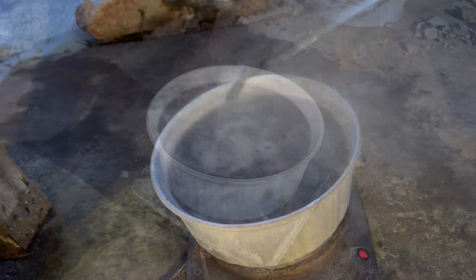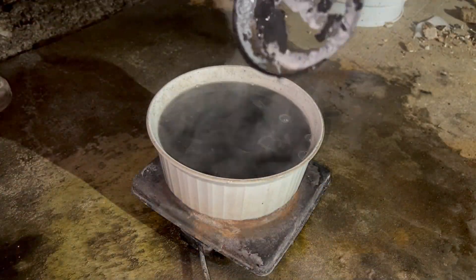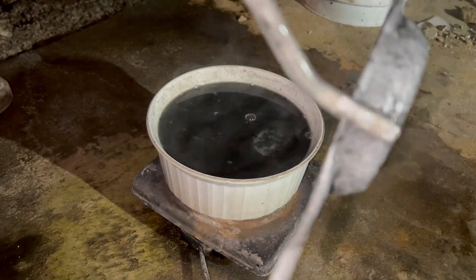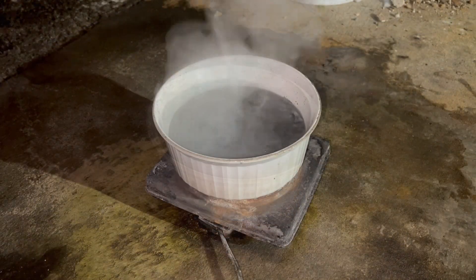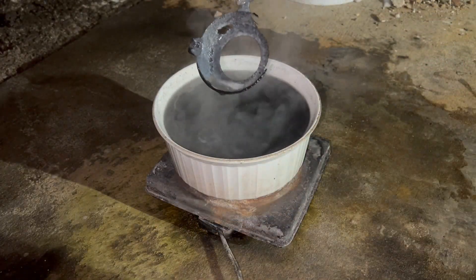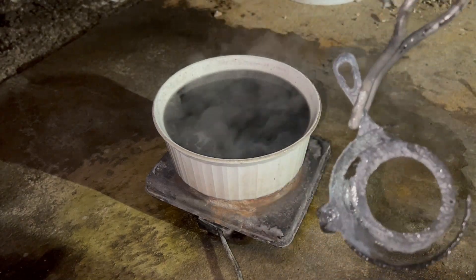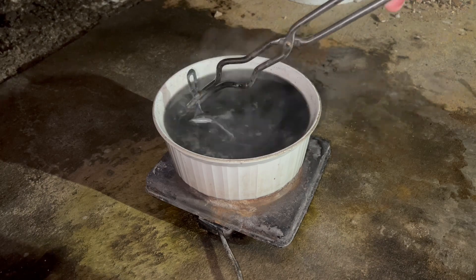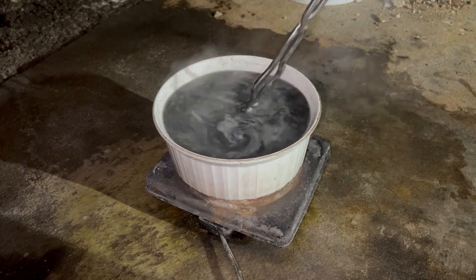A few times I add a little more sulfuric acid — in total probably about 200 ml in addition to the first 200 ml, but sulfuric acid is cheap for me so I don't really care. In total, the dissolution took about 20 hours. It turns black because there's graphite in cast iron, and as the iron dissolves, it's knocked loose and suspended in the solution.